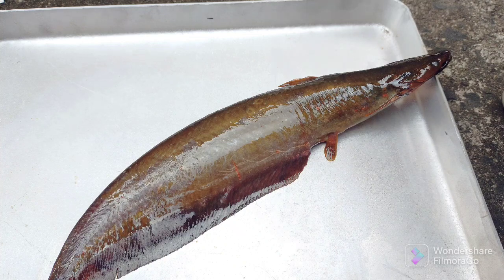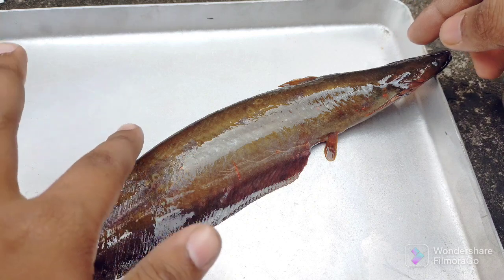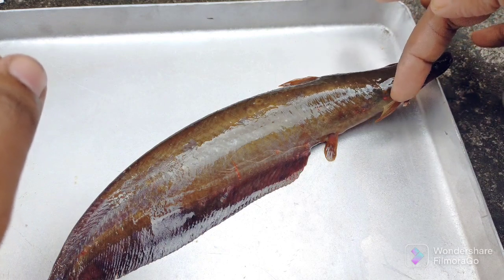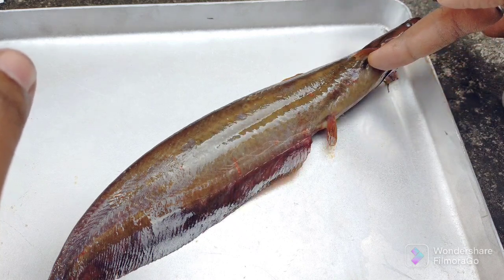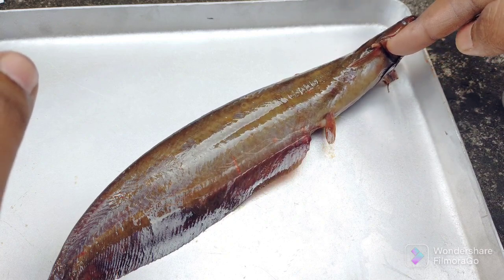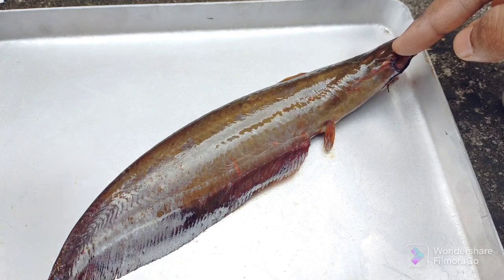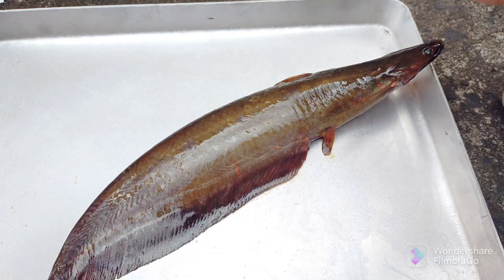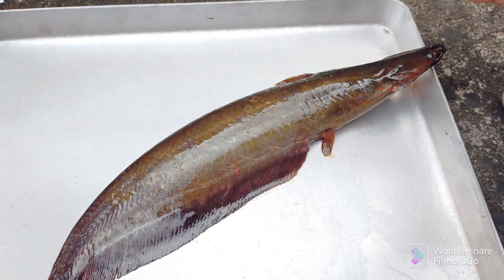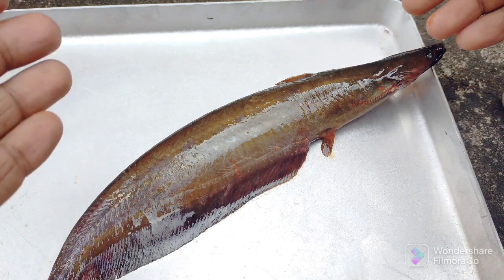It is called the stinging catfish because it bears a sting in the pectoral fin, present on both the right and left sides. It has a poison gland — not the kind that kills humans, but a gland that gives a painful sting. If it stings a human, it causes painful swelling and can even cause fever due to the pain.